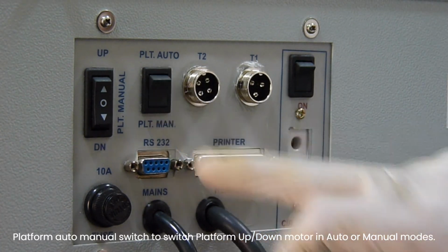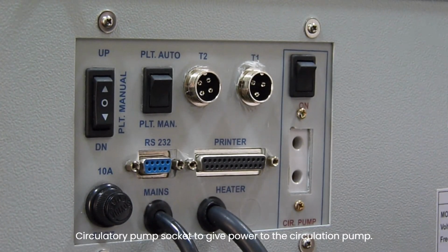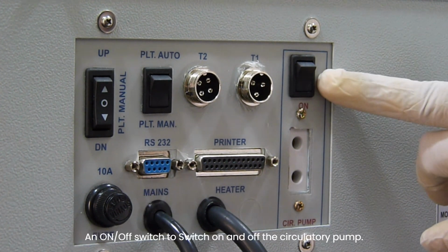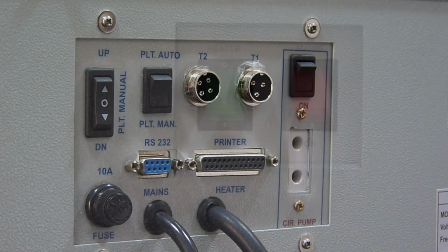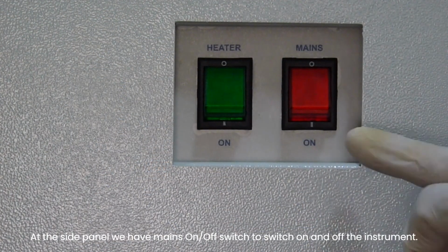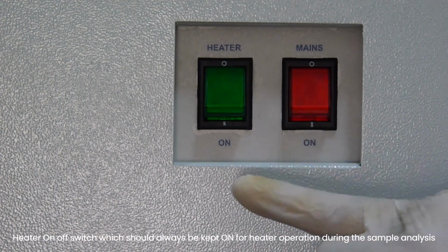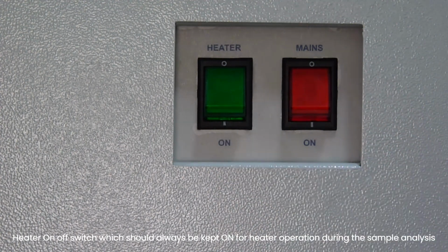Platform auto manual switch to switch platform up-down motor in auto or manual modes. Circulatory pump socket to give power to the circulation pump. An on-off switch to switch on and off the circulatory pump. At the side panel we have mains on-off switch to switch on and off the instrument. Heater on-off switch, which should always be kept on for heater operation during the sample analysis.